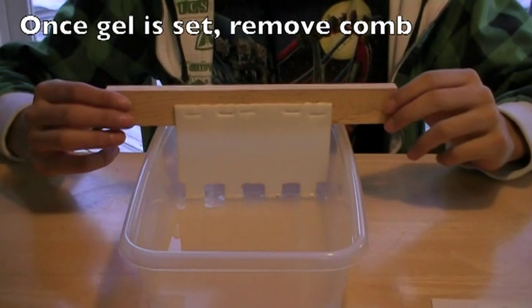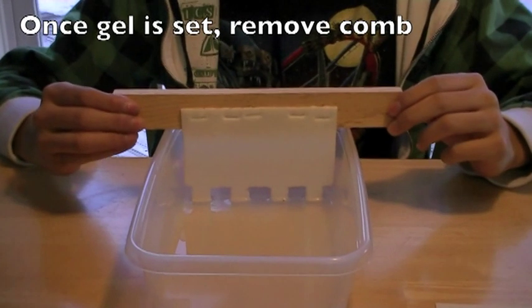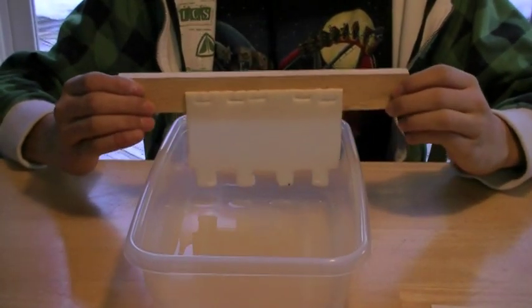Gently pull the comb out of the gel. The resulting wells will be used as reservoirs for your samples.